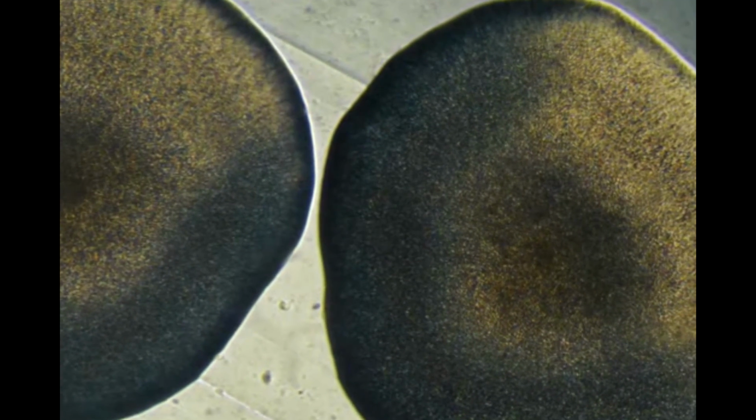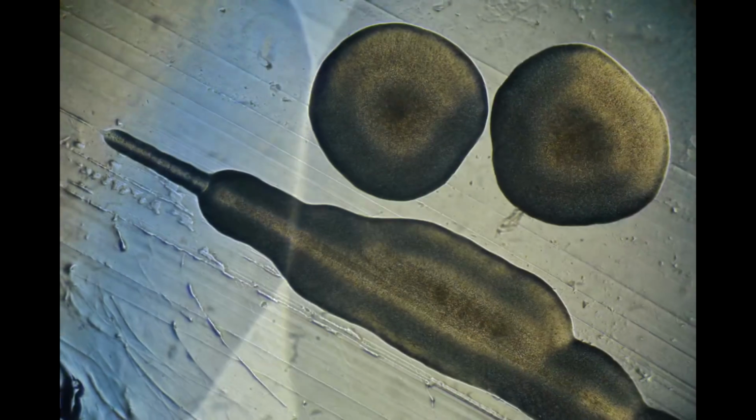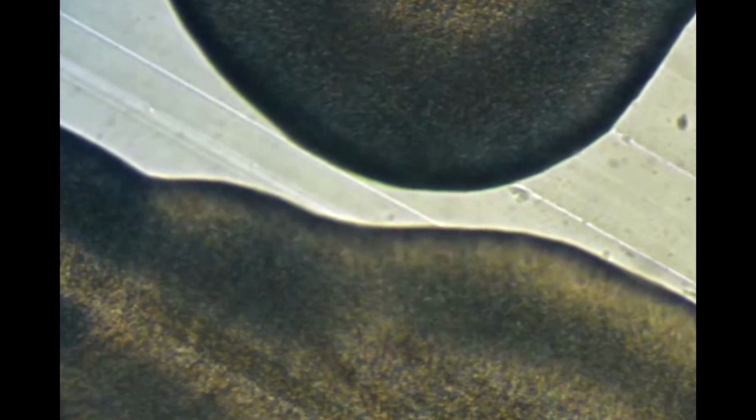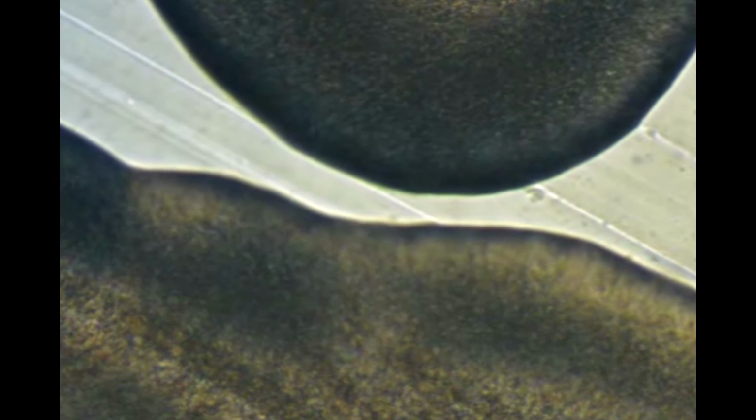One aspect that is clearly visible and for which there is likely a commonly accepted explanation is that up to a certain point, adjacent colonies seem to repel each other and form a gap. However, as colonies continue to grow, this gap eventually closes because there is really just no more space where cells can grow. But still, a line remains visible.